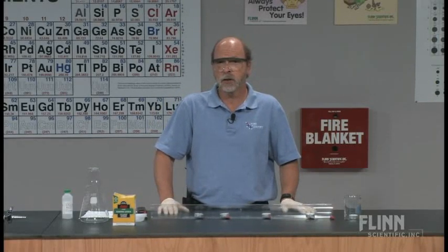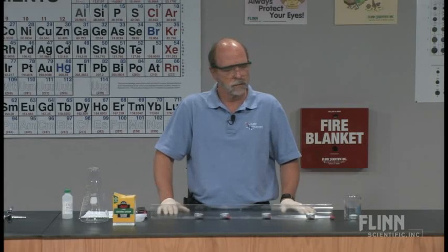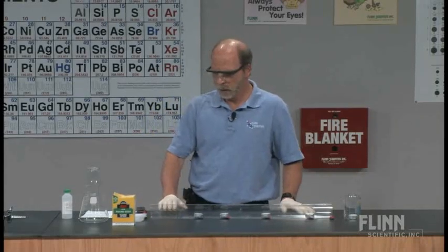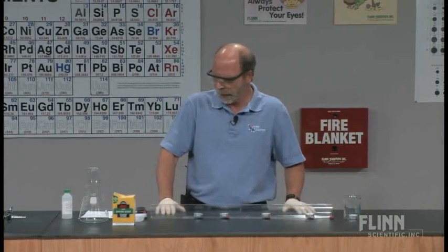Now, you can't see carbon dioxide when it is in the gaseous state because carbon dioxide is a colorless gas. But we can follow the path by which it travels as we observe the candles being extinguished one by one. And that's the neat part of the demo. So I'm going to do that right now.